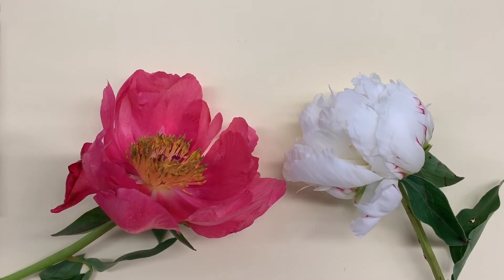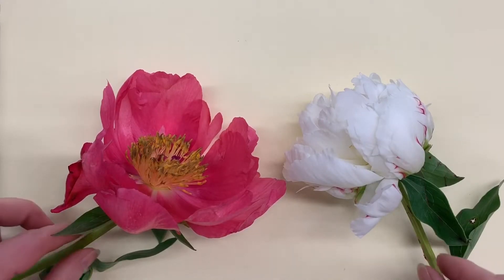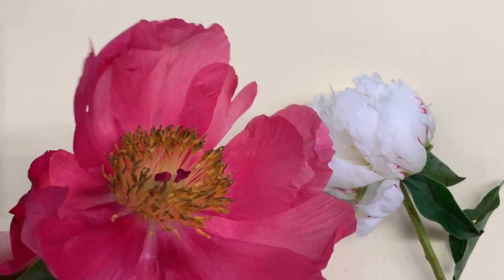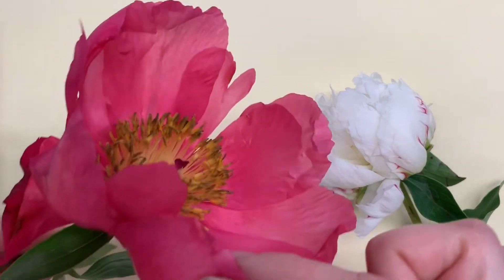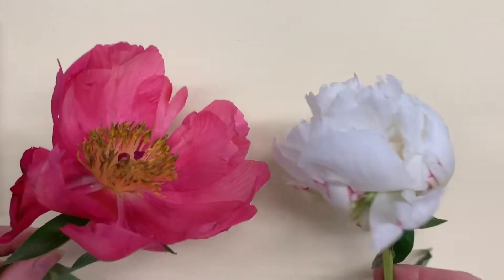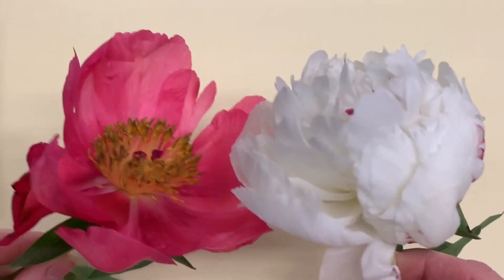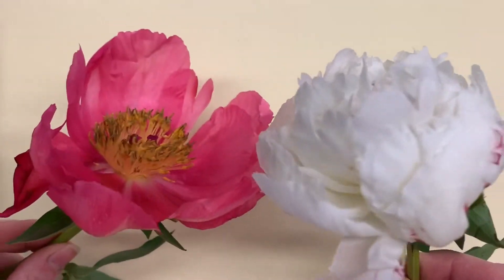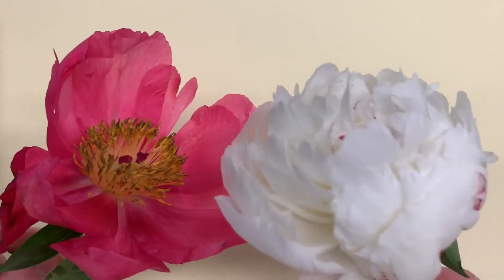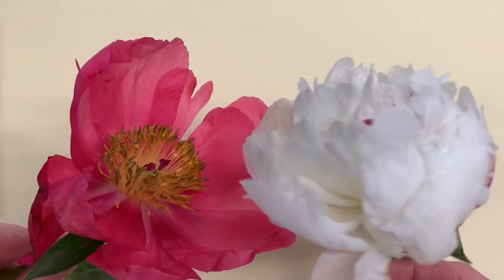These are both peonies. Peonies are excellent flowers to show you the different reproductive structures of a flower. Both of these are peonies, though they look different from one another, and as we've learned, there is a lot of variation within a single species.